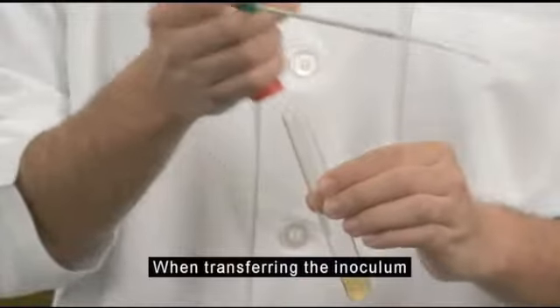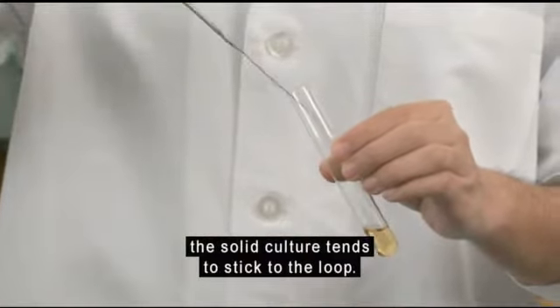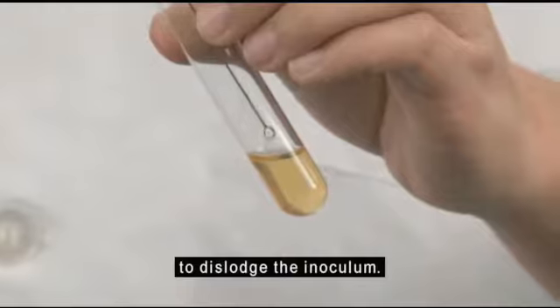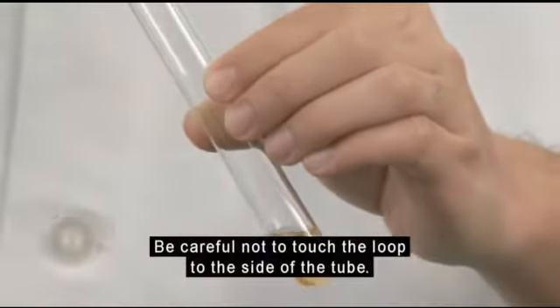When transferring the inoculum from the slant to a sterile broth, the solid culture tends to stick to the loop. So swirl the loop gently within the broth to dislodge the inoculum. Be careful not to touch the loop to the side of the tube.